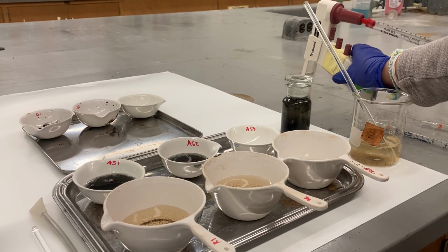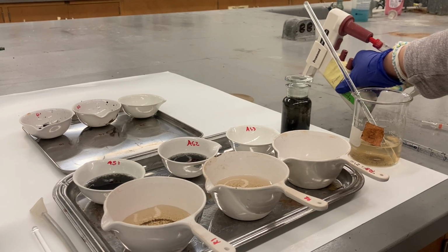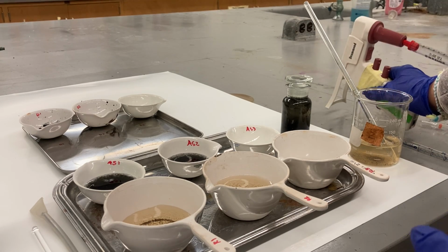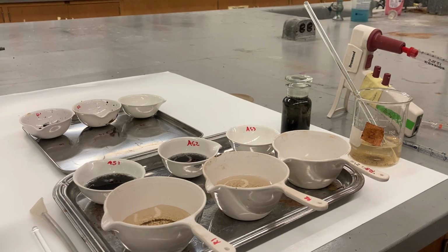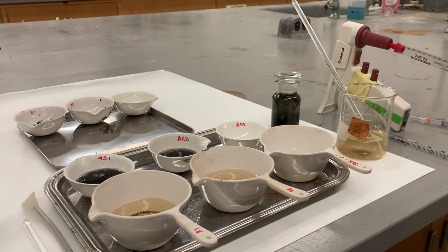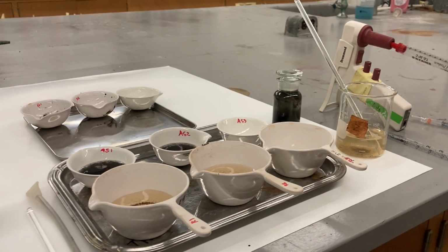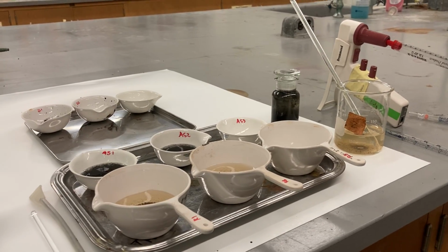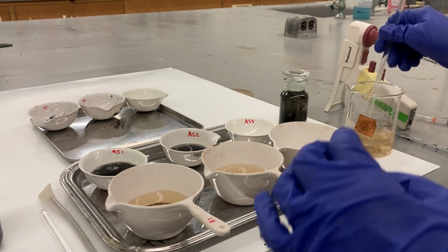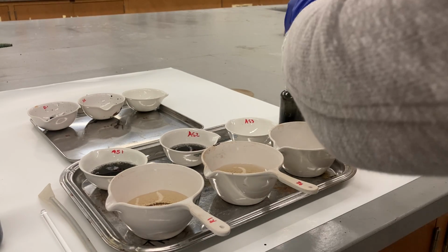When you use the same pipette, make sure when you rest it, it's supposed to be like this. The tip of the pipette should not touch anything. That's why I raise everything. The tip of the pipette does not touch anything, so I'm not contaminating it, so I can still use it. Okay, I mix it, then I'm gonna pipette 25 twice.